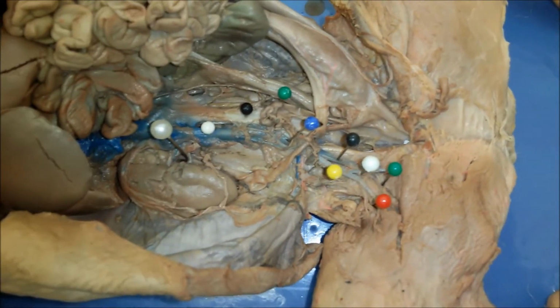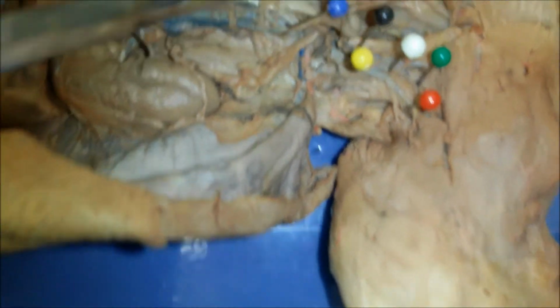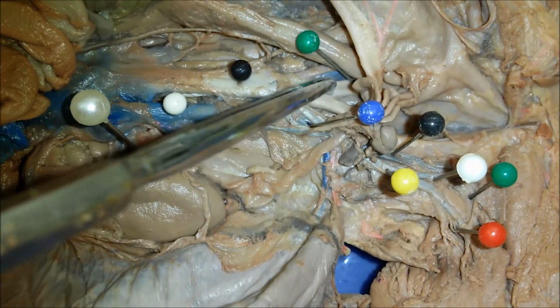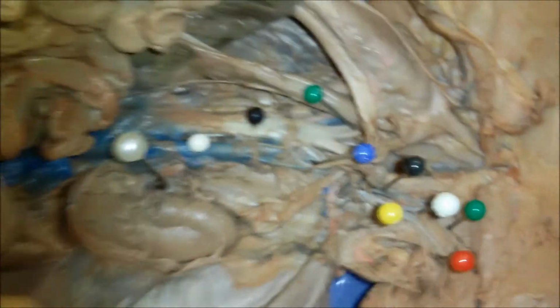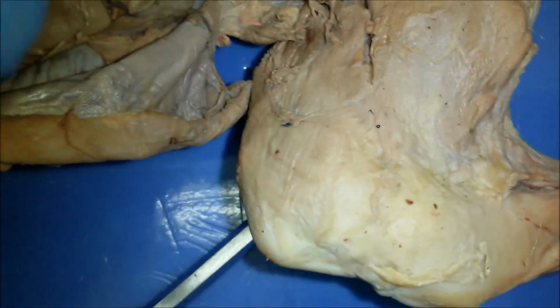And then, since this is a fetal pig, you're also going to see the umbilical arteries and umbilical veins, and so actually, right here at the end of the abdominal or descending aorta, you can see these large vessels, and so these will be the umbilical arteries. You can actually see that they continue on here on both sides.